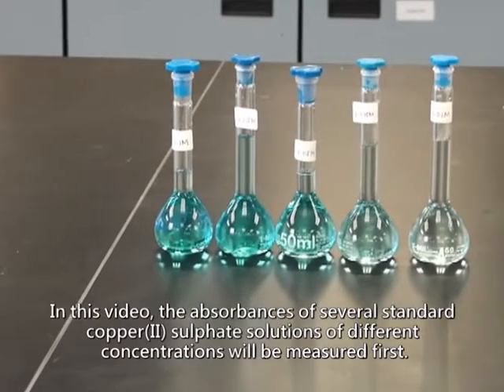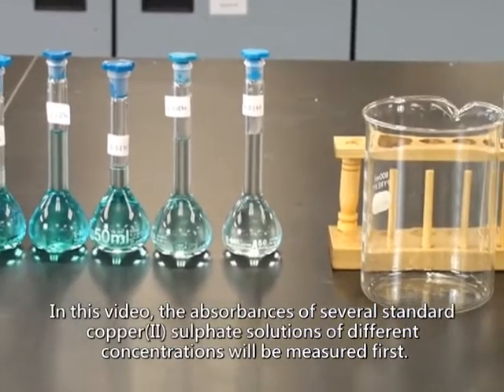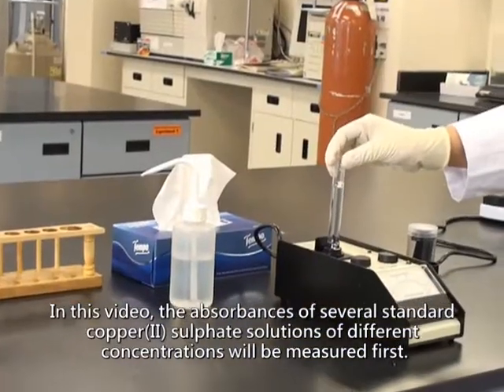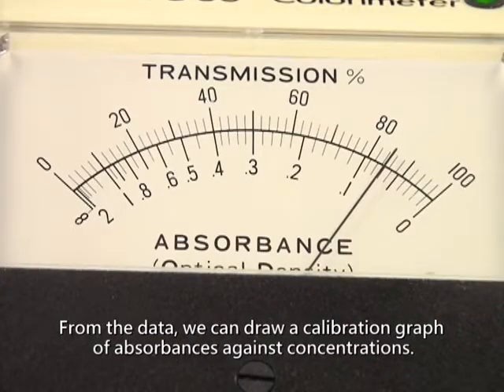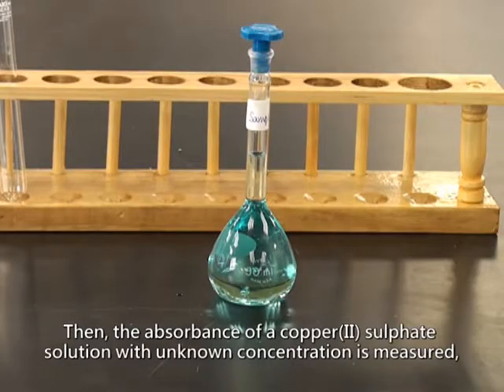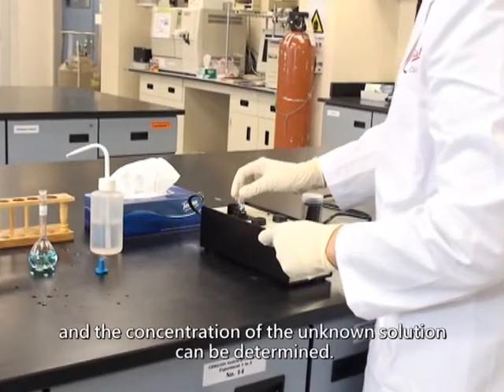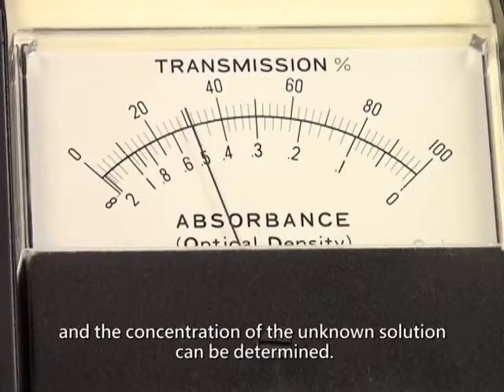In this video, the absorbances of several standard copper(II) sulfate solutions of different concentrations will be measured first. From the data, we can draw a calibration graph of absorbances against concentrations. Then, the absorbance of copper(II) sulfate solution with unknown concentration is measured, and the concentration of the unknown solution can be determined.